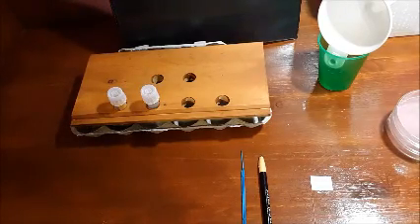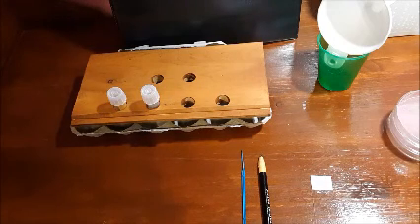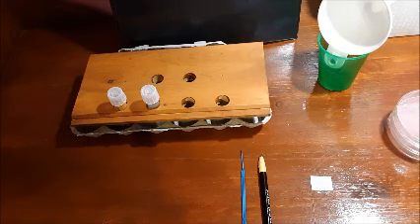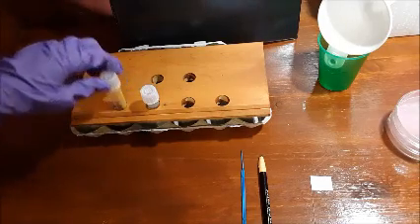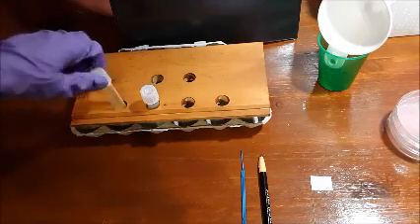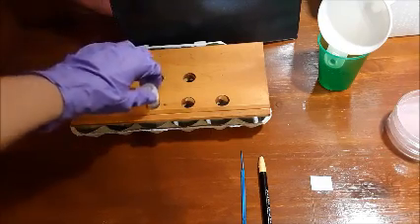Before you can view the characteristics of our unknown bacteria, you will need to gather the right materials and set up your workspace. So the next experiment that we will be conducting involves using a sterile broth. For this experiment, we'll need our unknown bacteria, which is right here. It is our slant stock culture. Our sterile broth, which is in this test tube right here.